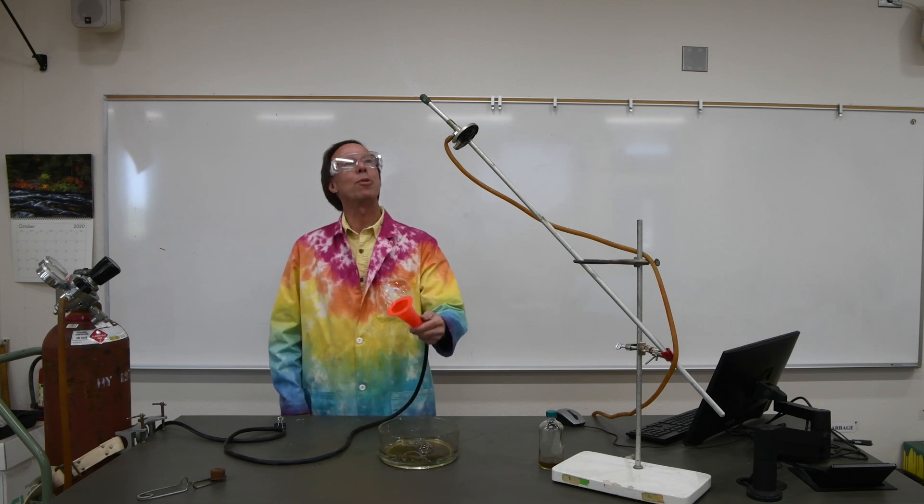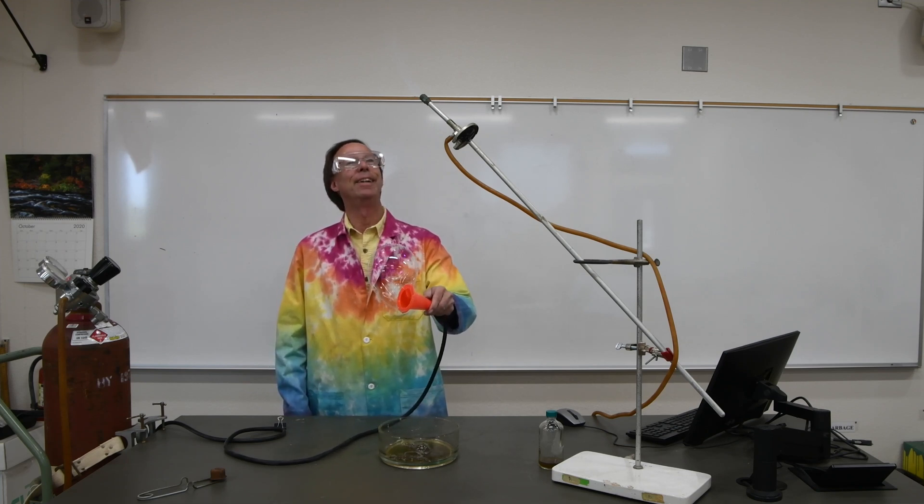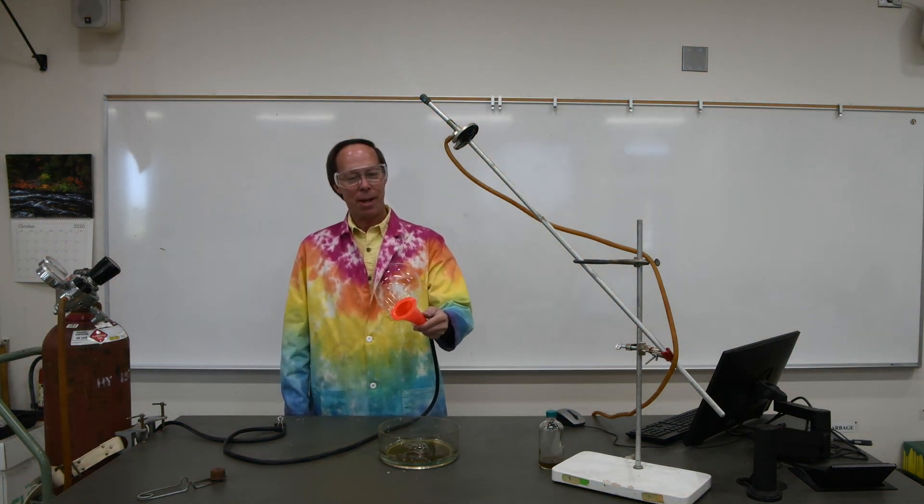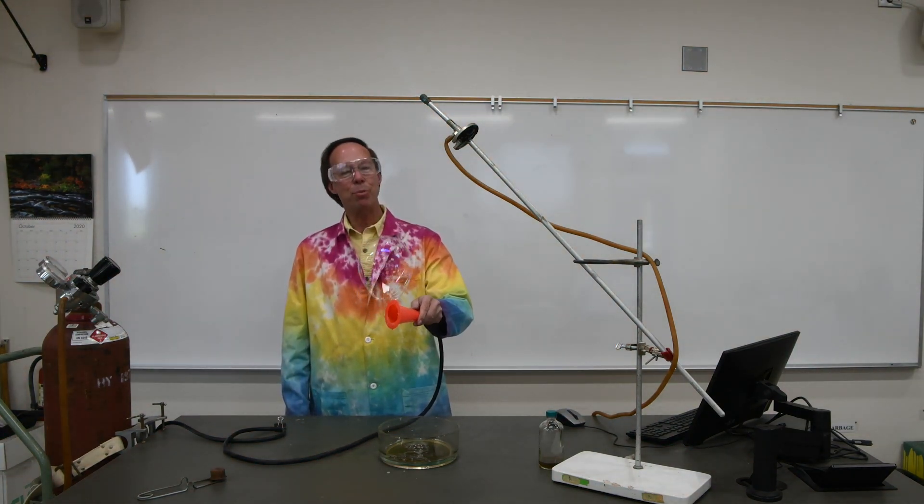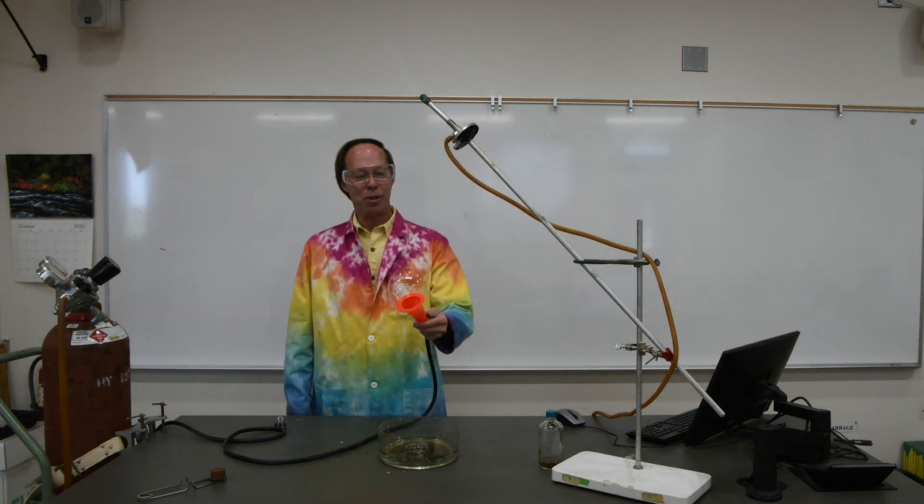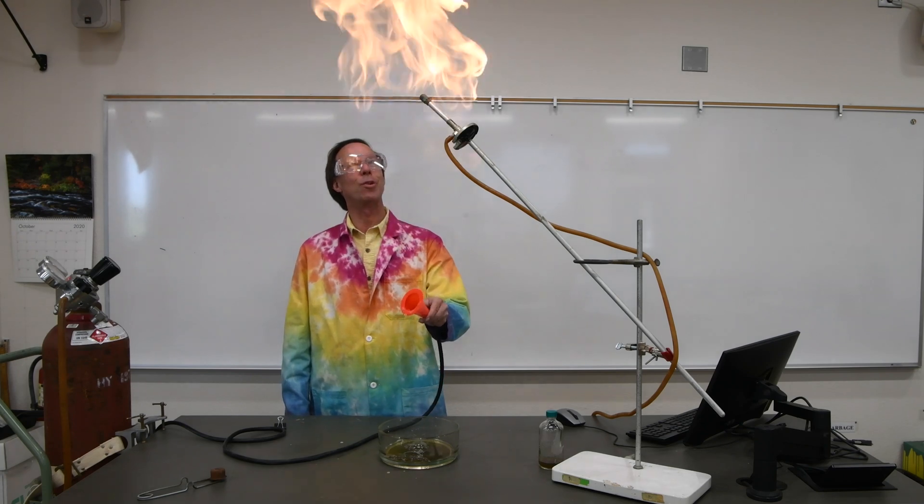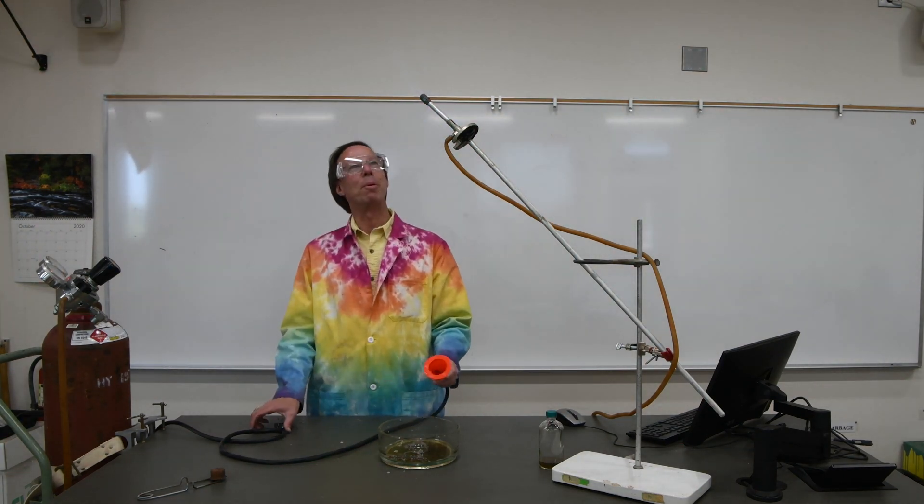If you were here in person you could really feel the heat coming off of that. So methane with about half the density of air floats very nicely. You could actually fill a balloon with methane as we did before. They float very well but it is, as you can see, quite flammable.